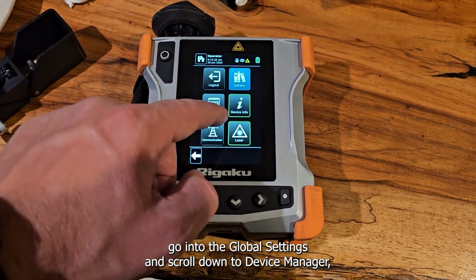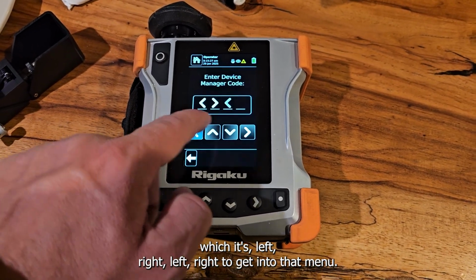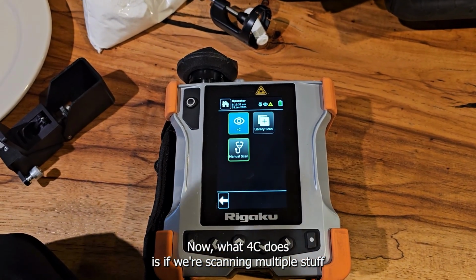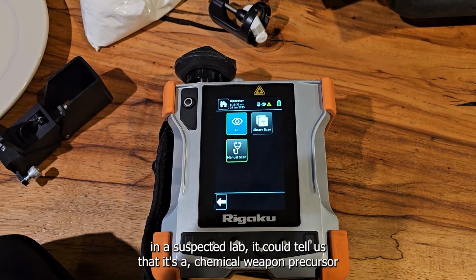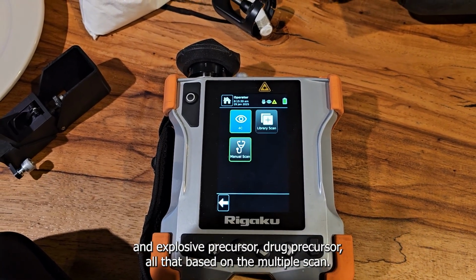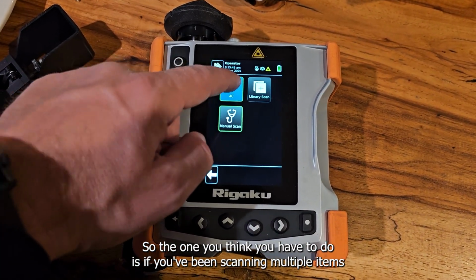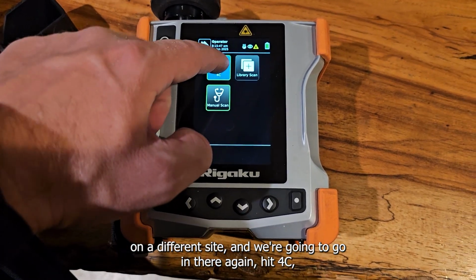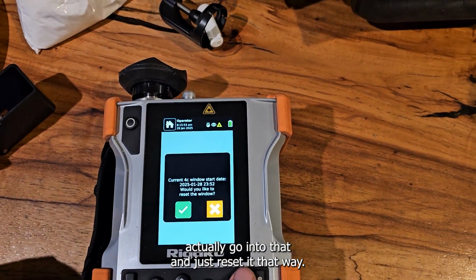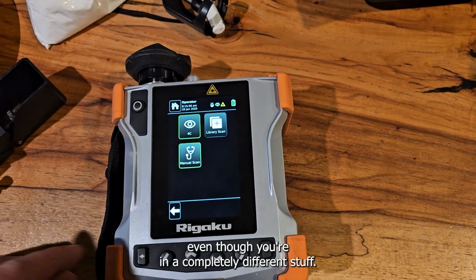And then if we go into the global settings and scroll down to device manager, which is left, right to get into that menu, there's this thing called 4C. Now what 4C does is, if we're scanning multiple things in a suspected lab, it could tell us that it's a chemical weapon precursor, an explosive precursor, drug precursor, all that based on the multiple scans. So the one thing you have to do is, if you've been scanning multiple items on a different site, go in there, hit 4C, and just reset it. That way it doesn't tell you that you're scanning all the same stuff and now having a different precursor, even though you're at a completely different site.